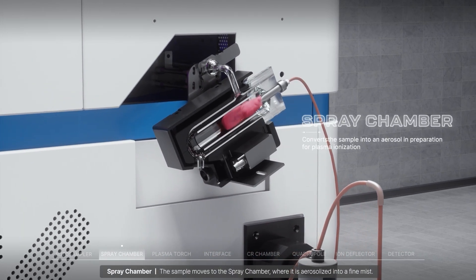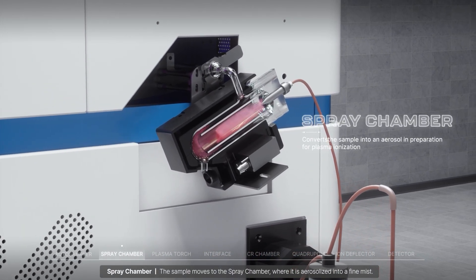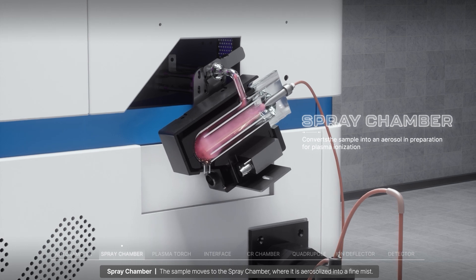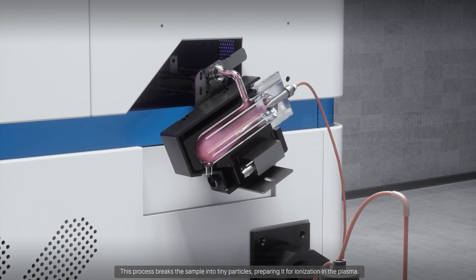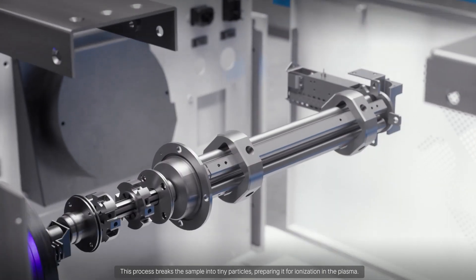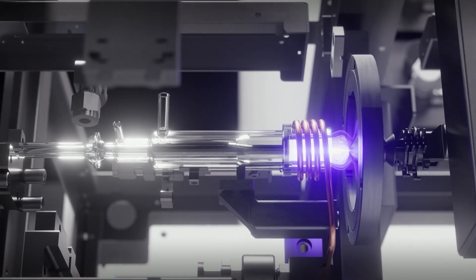The sample moves to the spray chamber, where it is aerosolized into a fine mist. This process breaks the sample into tiny particles, preparing it for ionization in the plasma.